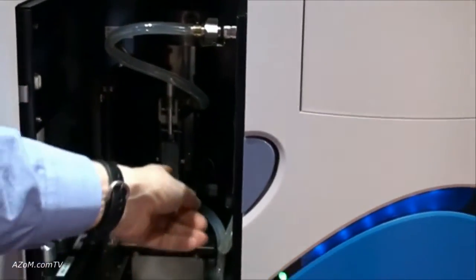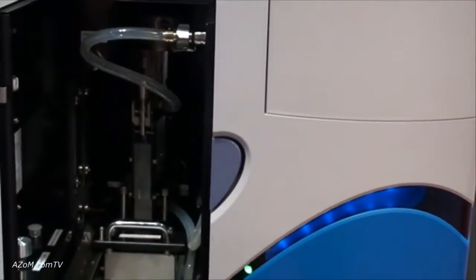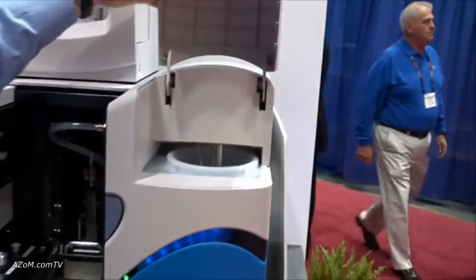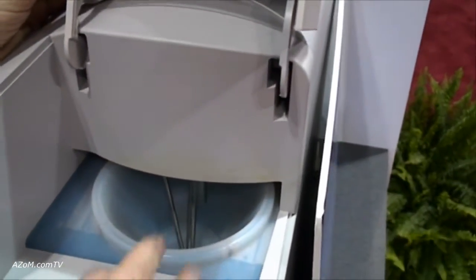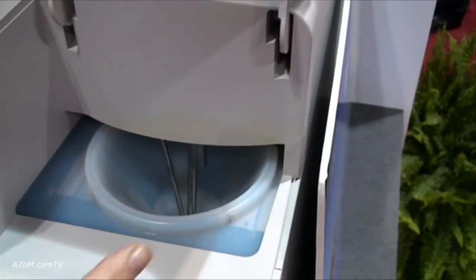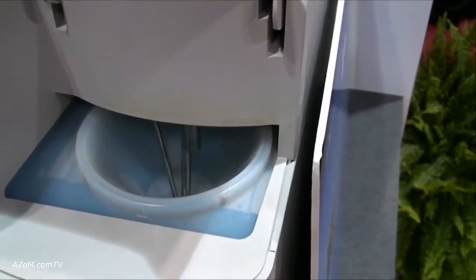All of the action takes place right here in the cell in terms of the light scattering. We need to introduce the sample to that cell, and with this unit we have two different ways to do that. For particles in liquid suspension, there's a reservoir with water or a solvent recirculating. We introduce the sample to the reservoir, a pump recirculates the sample, there's also a stirrer, and there's an ultrasonic probe if we need to add energy to break up agglomerates.